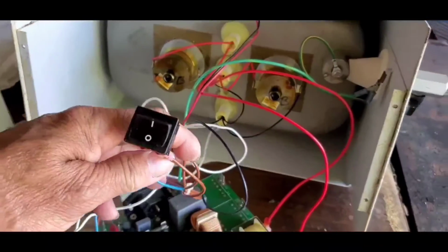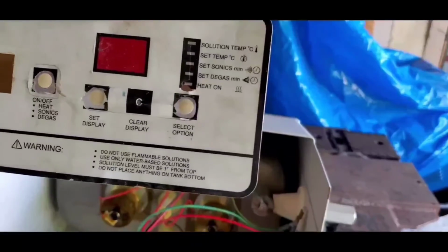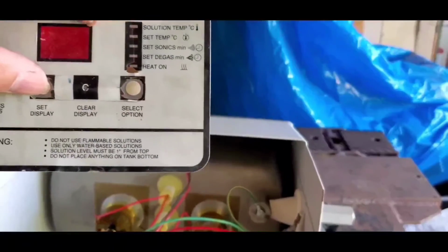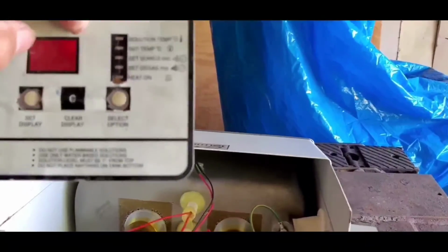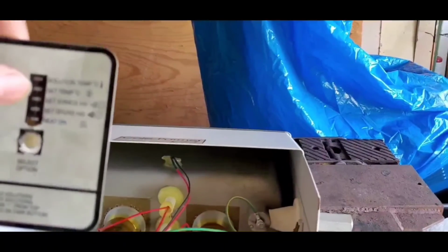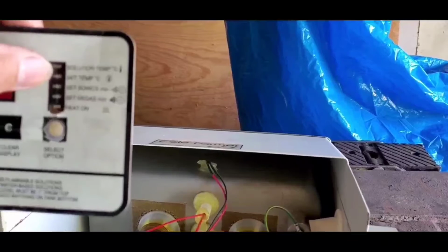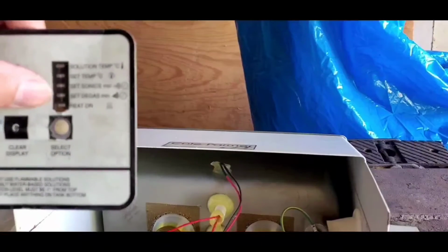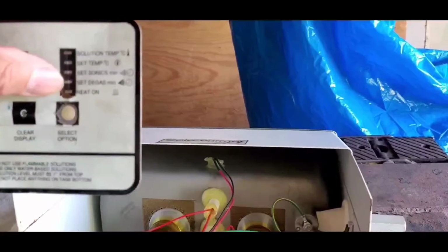This one is the on and off switch, and here you can see the power, the on and off for heat, sonics, and the degas. This is the display. This is the button where you can set the display, and this is the clear button to clear up whatever is in the display. And also there are settings for the solution temperature, to set the temperature, and setting of the sonics minutes, and setting of the degas minutes. And this is the heat control, on and off, the indicator.